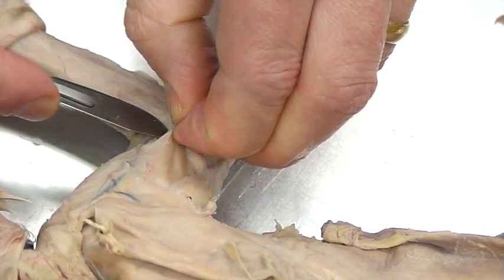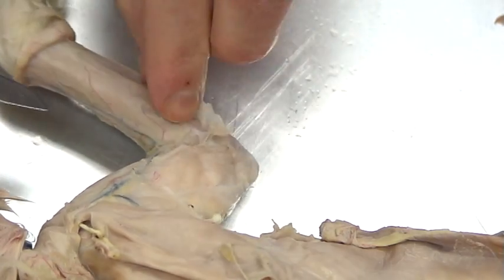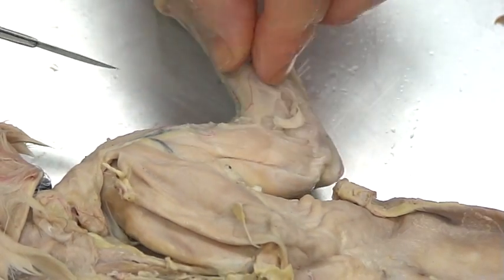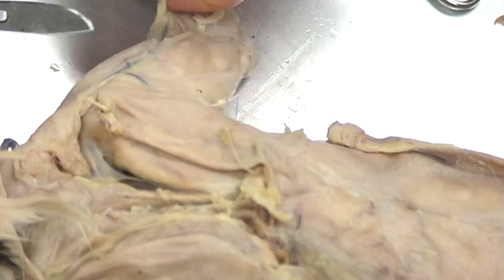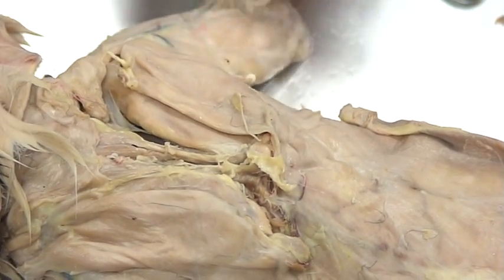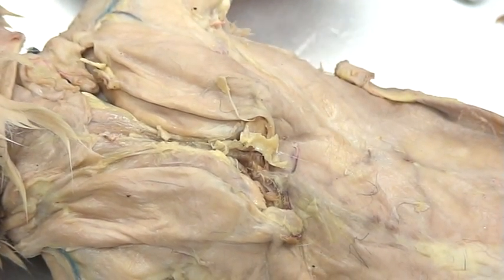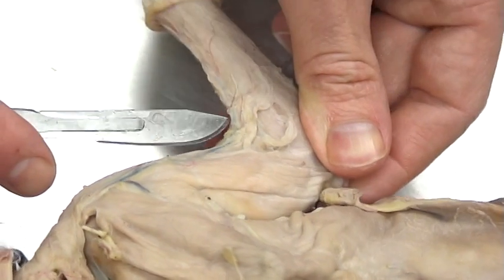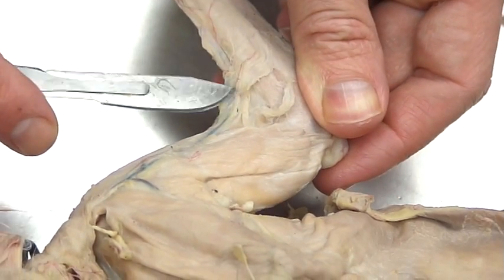There's one place I want you to be very, very careful with. As you cut away, this fascia comes in a lot of layers to expose all of your forearm muscles. But right along here with the blood vessel, there's a very, very thin strip of muscle that most students will actually cut off accidentally — they won't even know there was a muscle in there — and that's called the brachioradialis muscle. So be very, very careful. This is the brachioradialis muscle.